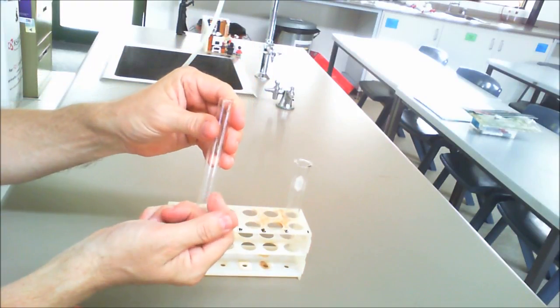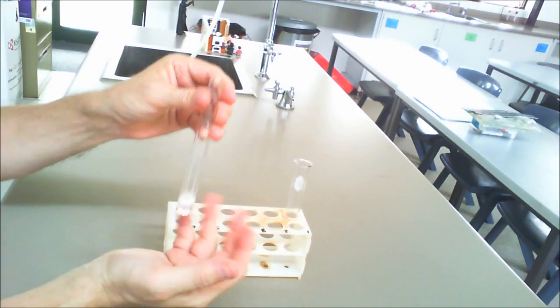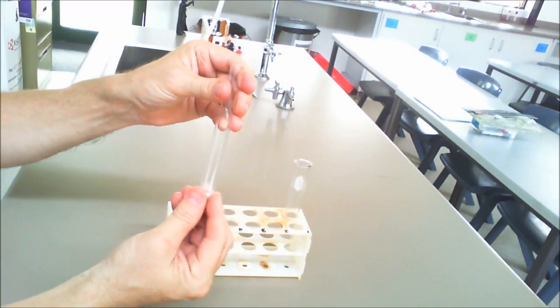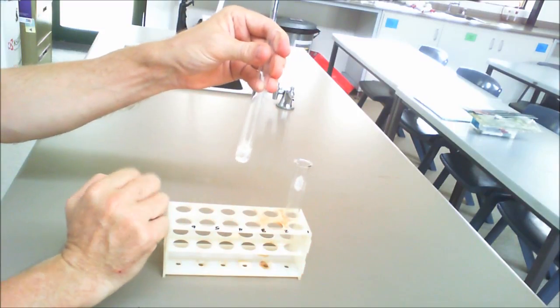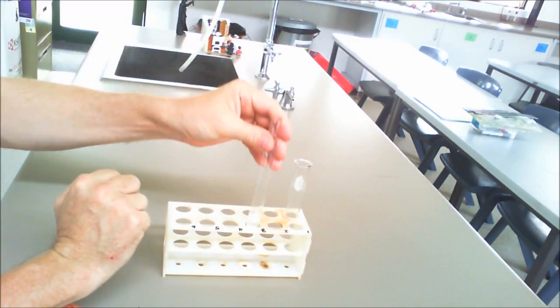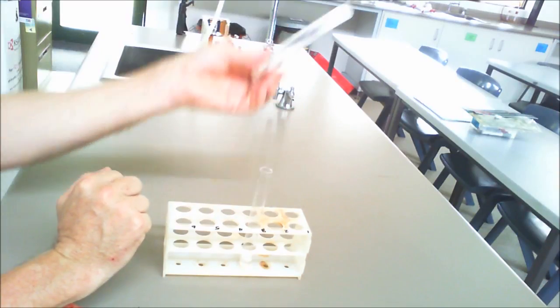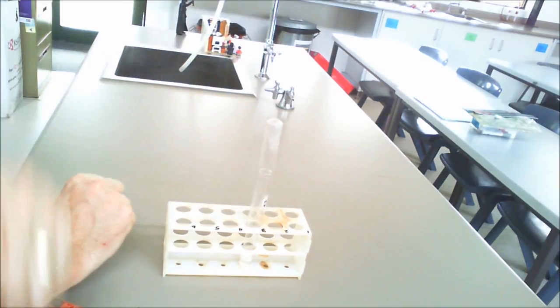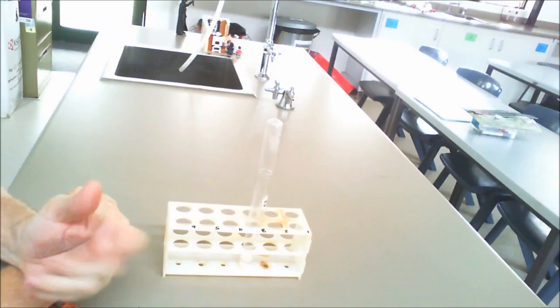If you were to feel this, this has actually got quite warm here, so it's what we call an exothermic reaction. It produces heat on the outside and it's still bubbling along there, so what I could do is I could do the same test again and place that like that to collect more.